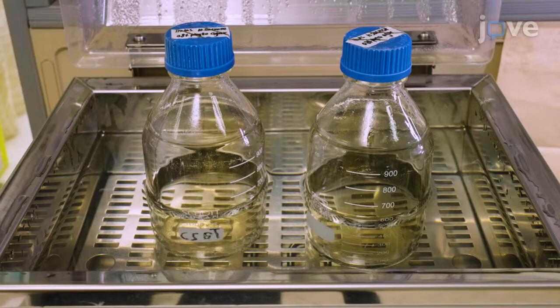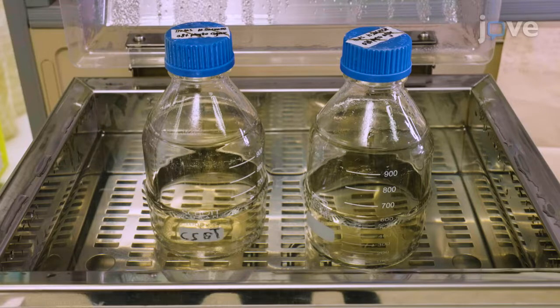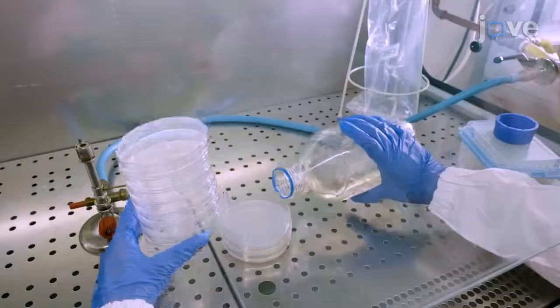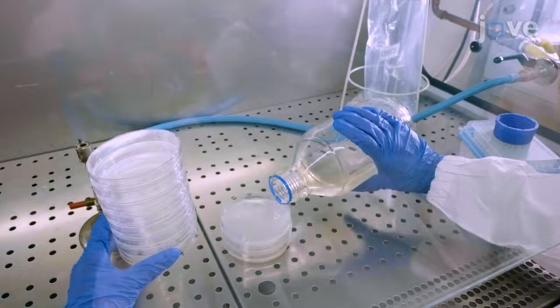After autoclaving, allow the medium to cool down to 50 to 53 degrees Celsius in a water bath, then pour it into petri dishes under the laminar flow hood.